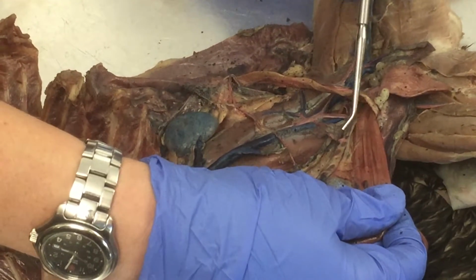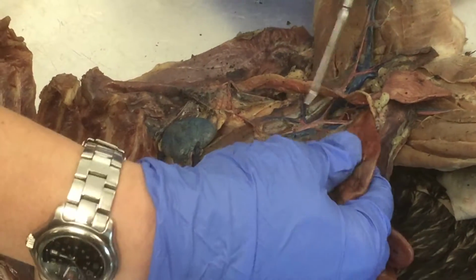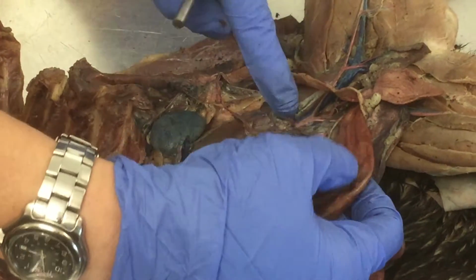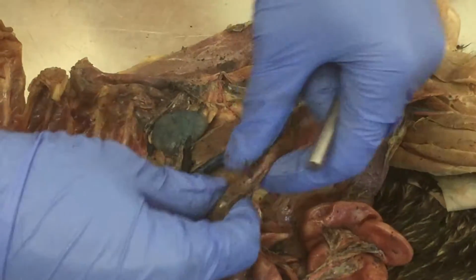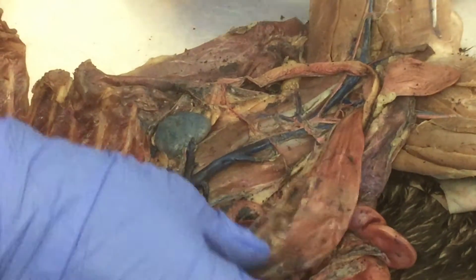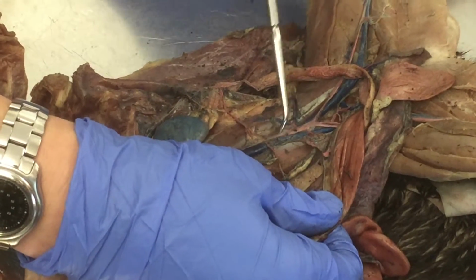Then coming down a little bit further, feeding the large intestine. It's detached here, but this artery and this little stub here should make a connection. Okay, so you'll find a big branching coming off of abdominal aorta, feeding the large intestine. So here's large intestine going towards the anus. Here's the bladder. Okay, so this is inferior mesenteric, feeding the large intestine.